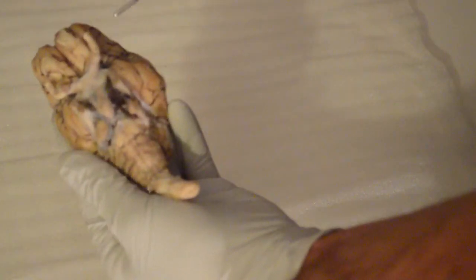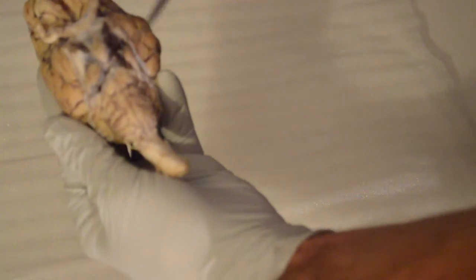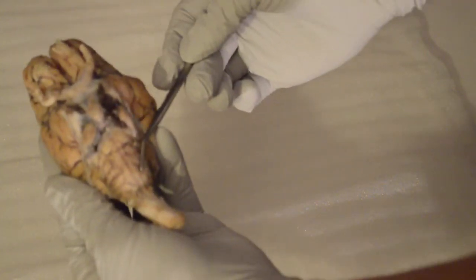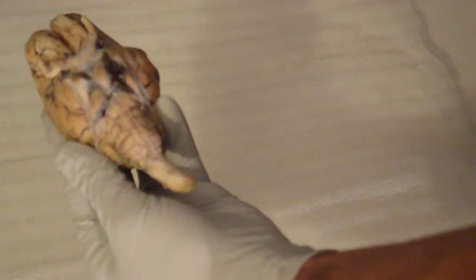Okay? Moving on to the medulla oblongata, which is right here, this region right here. This is the lower part of the brain stem. A very important factor, actually, because it helps regulate and even sustain some of the breathing, swallowing, and even heart rate functions that we have every single day. So when we go on a jog, this is what raises or lowers the heart rate, whether we want to relax or go higher.